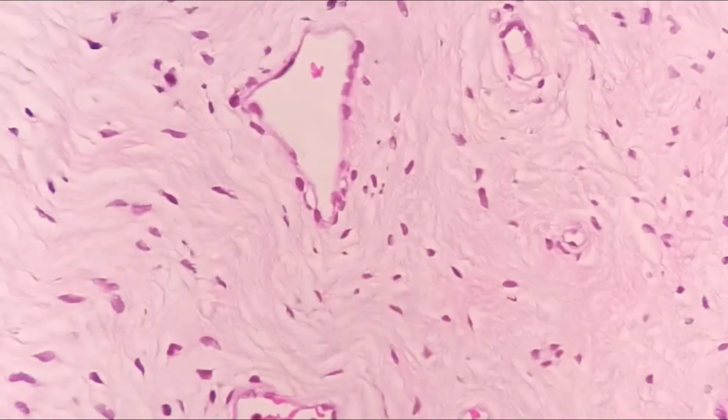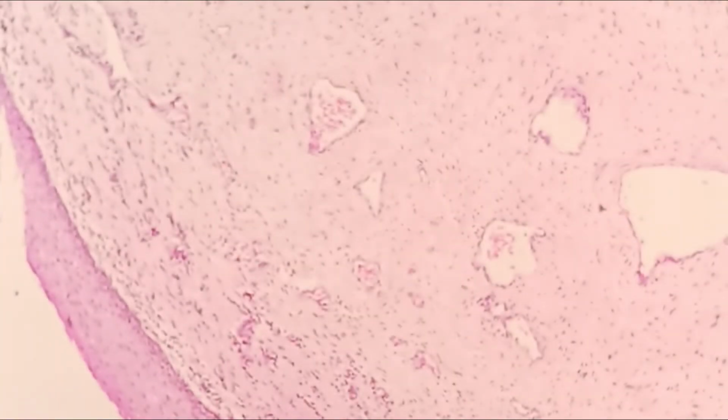And the stroma of the cervix, the stroma is actually the part which made up of tissues underneath the epithelial lining. So it is composed of a fibrous tissue and also smooth muscle. And you can see within this field there are few blood vessels within it.